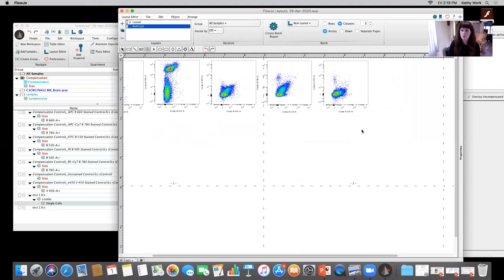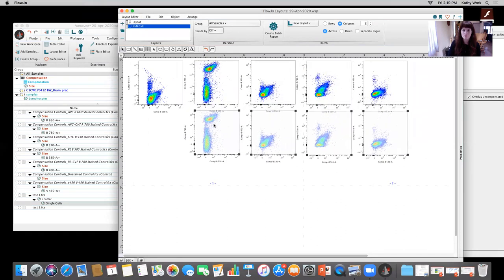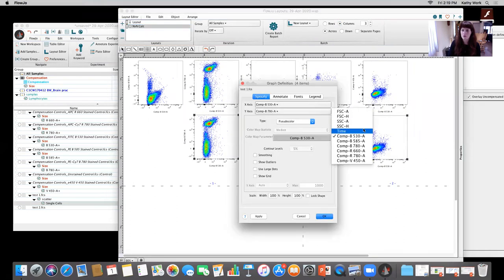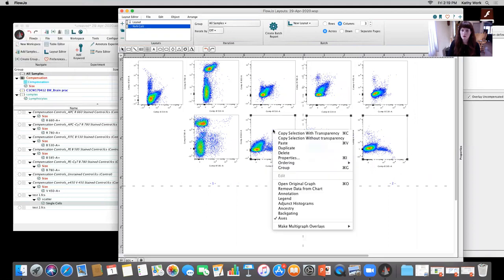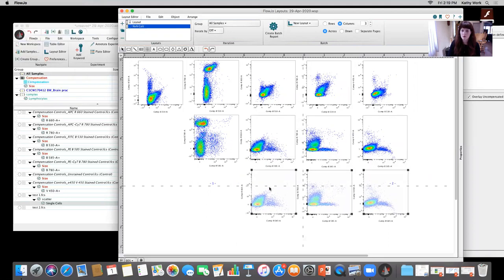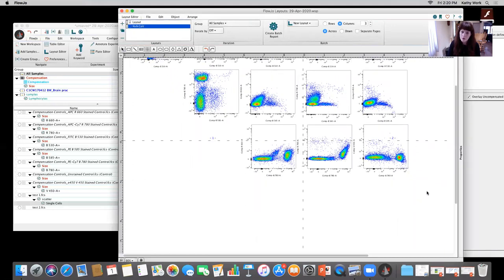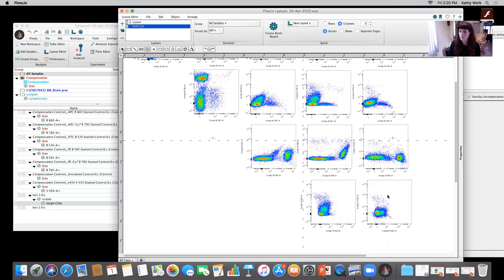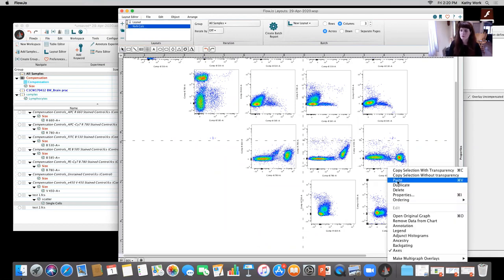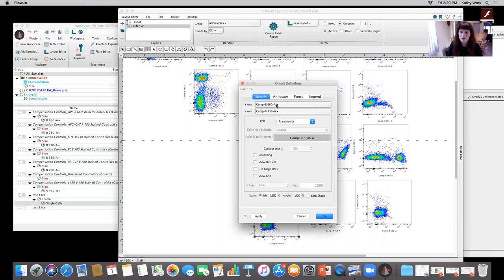Apologize that it didn't carry through from my workspace. I'm gonna save some time. I can go ahead and duplicate that. Come down, double click, and then I can change all of these to the secondary detector, which is the 585. And I could duplicate those and go on and on. Just to double check the N by N of everything, if you prefer to work in this way, like I do. Okay, I can make a traditional N by N, or I can drag it over to try and get a better view here.